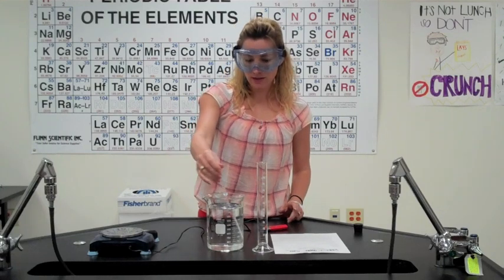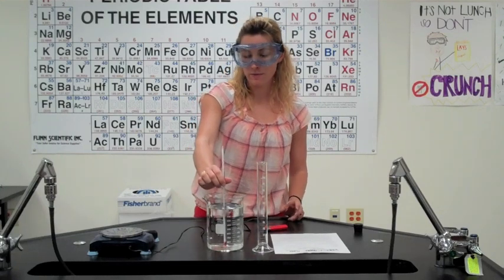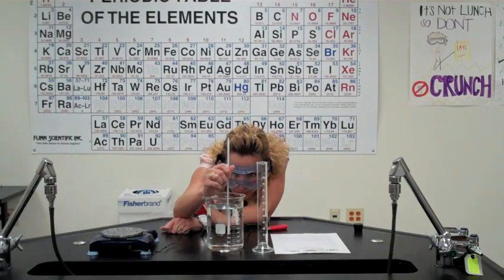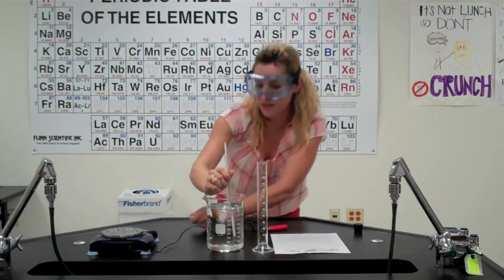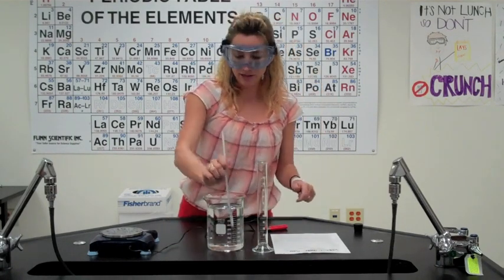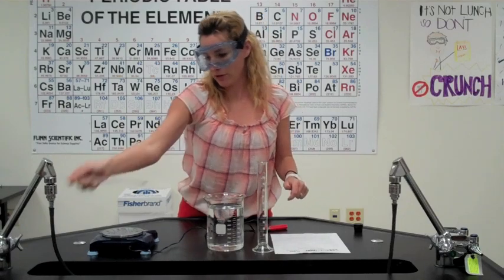First thing we need to do is get the temperature of our water bath so that we know what we're working with. The temperature of this particular water bath is 22.0 degrees Celsius, so we're good there.